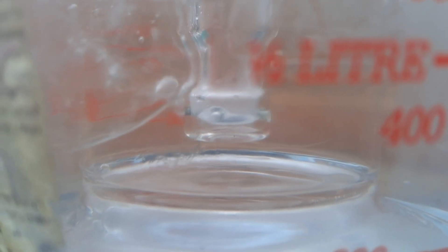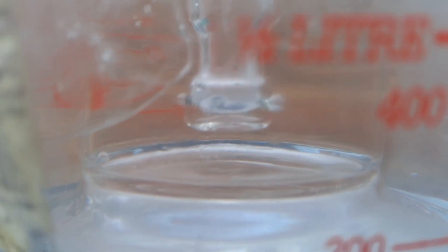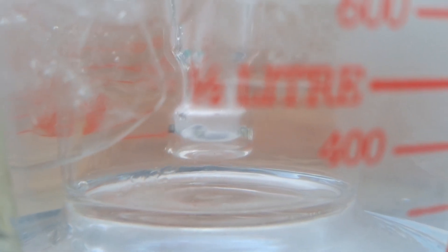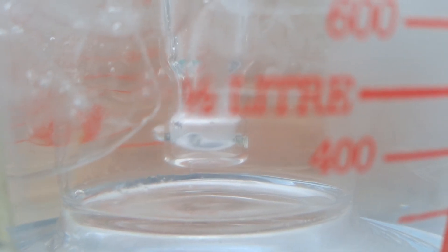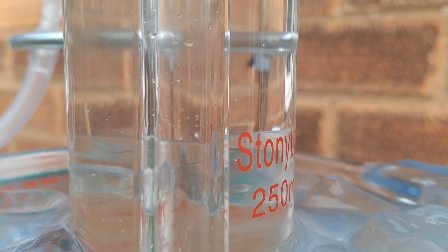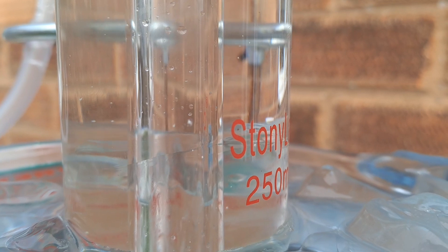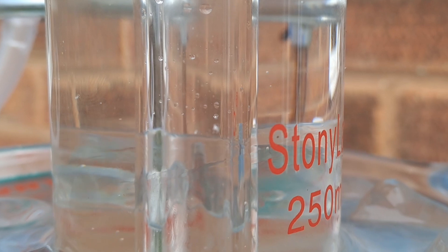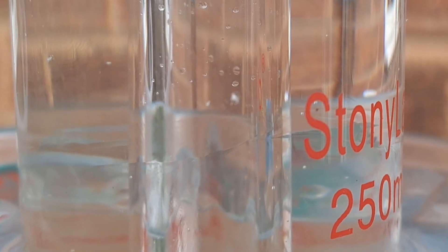The waves you see in the hydrochloric acid where the HCl gas is bubbling are caused by differences in the refractive index due to localized changes in concentration and density. As the HCl gas dissolves, it significantly increases the local concentration of hydrochloric acid in the immediate area where bubbling occurs, creating regions of varying density in the liquid which affects how light bends when passing through. More concentrated HCl has a different refractive index than the surrounding solution. These variations cause light to bend in irregular patterns, making the waves visible. The gas bubbles disturb the liquid, creating currents that further enhance the refractive effects, producing a shimmering or wavy appearance.